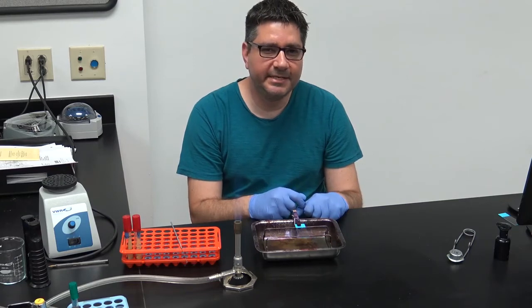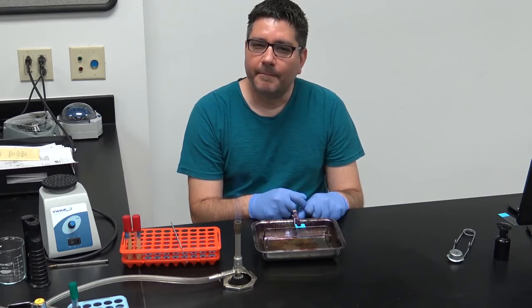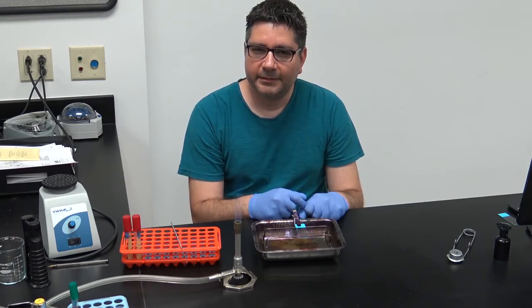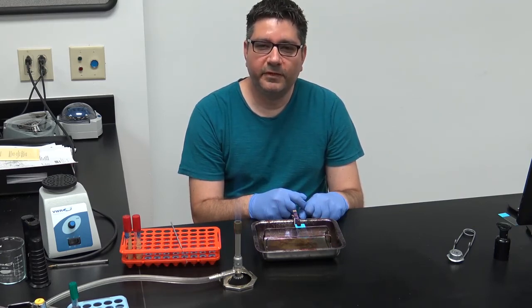The next step is to decolorize with acid alcohol. Non-acid fast bacteria will lose the primary stain, but the Mycobacterium will retain it. Rinse with DI water and counterstain with methylene blue for 1 minute. Lastly, wash with DI water and drain. You do not use bibulous paper on this slide, as you may remove the organism. Allow the slide to air dry.